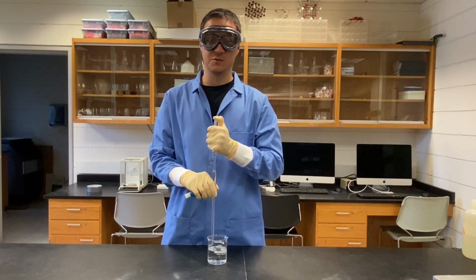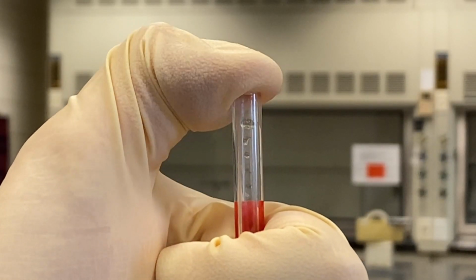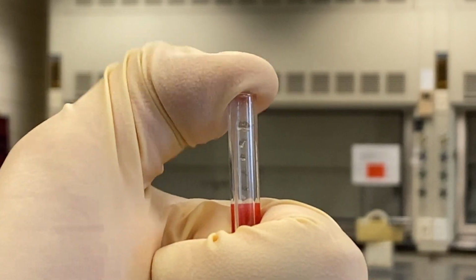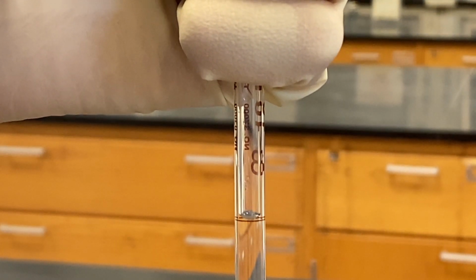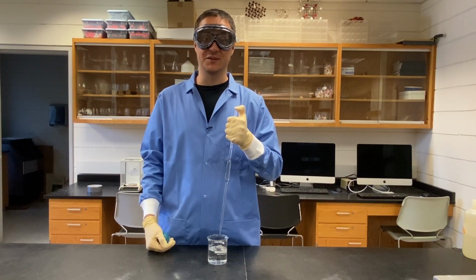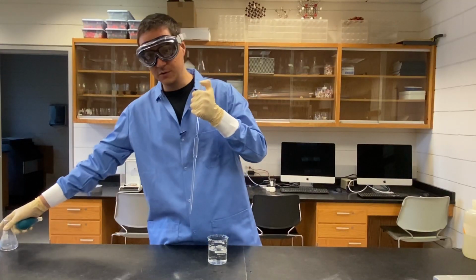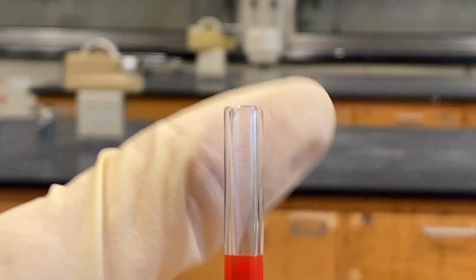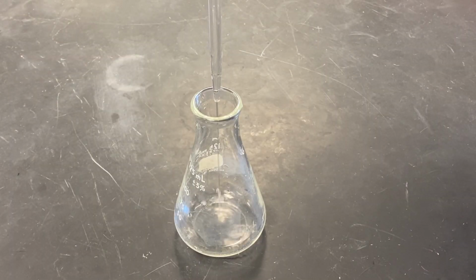Now the pipette is removed from the liquid, and the excess is slowly dispensed by partially removing the finger over the opening. The final liquid level should align with the calibration mark. It may take a few tries to get the correct volume, but you'll improve with practice. Once the calibration mark is reached, the pipette is held over a new container, and the finger is removed to dispense the liquid. Gravity will drain the pipette.